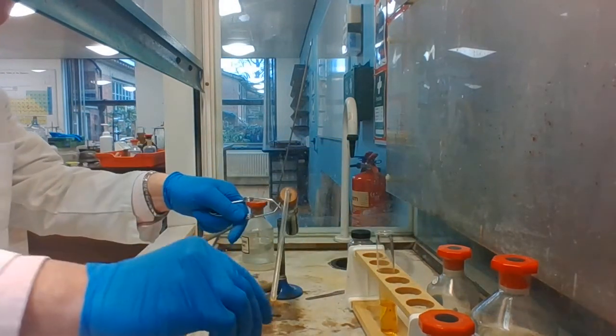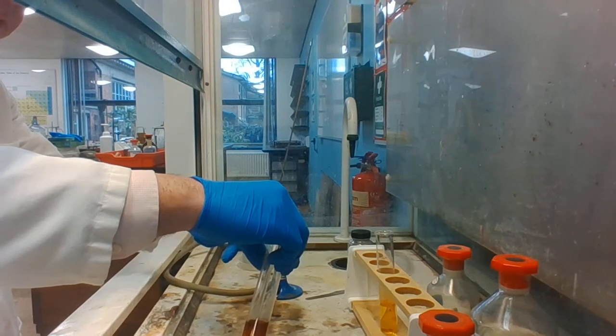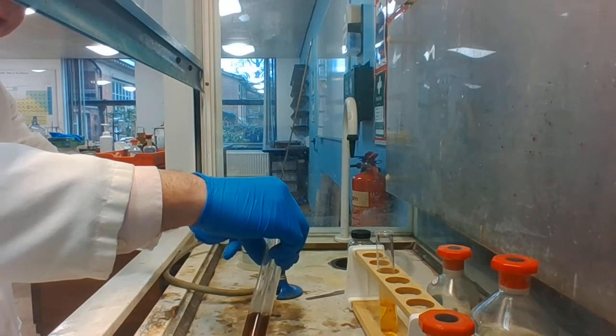And now if I bubble it through some potassium iodide solution, you can see the solution is going brown.